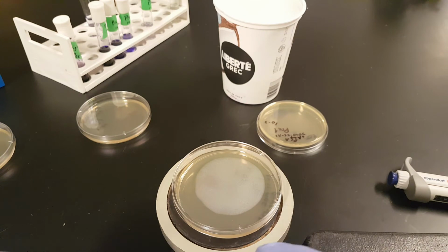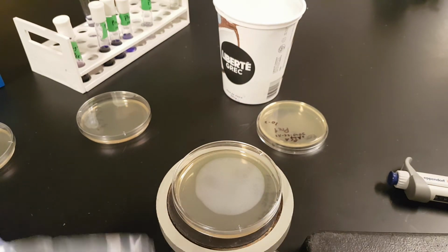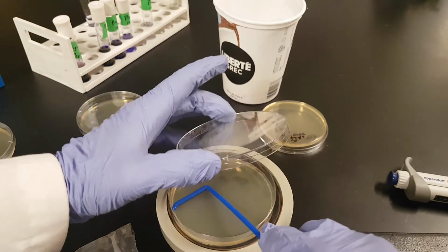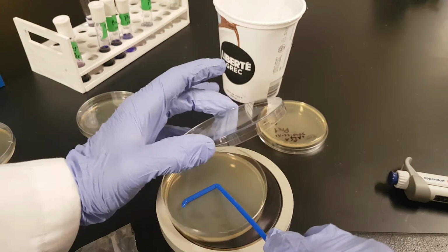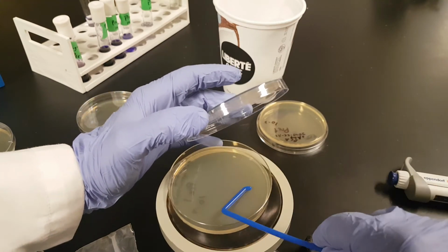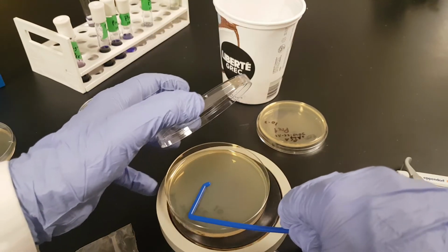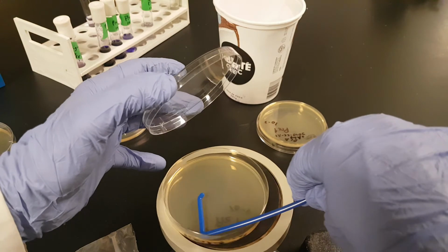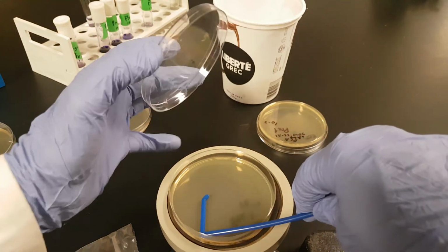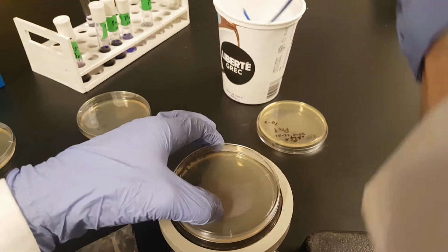Okay, again, grab the spreader, and we're going in. Okay, so just turn it, just sort of spread things, you can swirl it around a little bit. Sometimes it works well, sometimes it doesn't. You can go the other direction. You just want to make sure that you don't end up with a bunch of stuff caught around the edges. It's very easy to do that, so make sure that you're actually touching the edges and bringing things out. Once you're done with that, toss it.